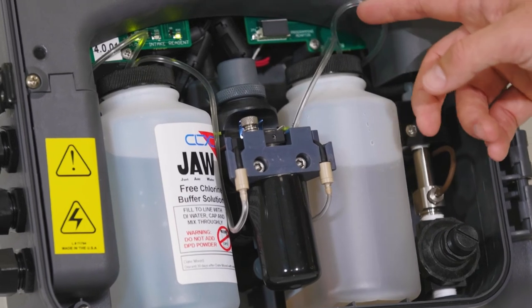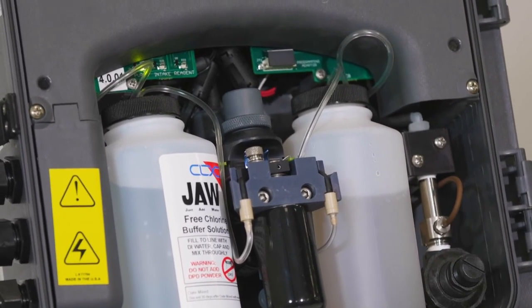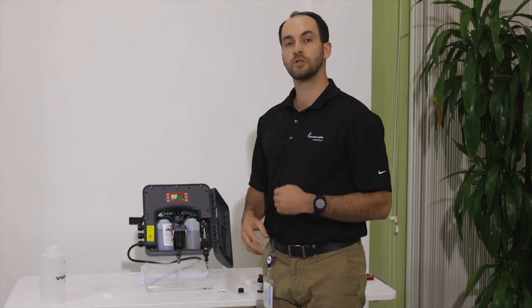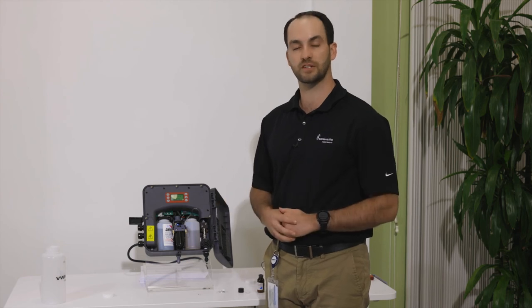And as long as you're good, as long as you can see that reagent moving through, then you're ready to go. And the analyzer will go back into normal operation. It will go into a water cal mode, which basically runs a little self-diagnostic, and then it will begin operation in the next two and a half minutes.